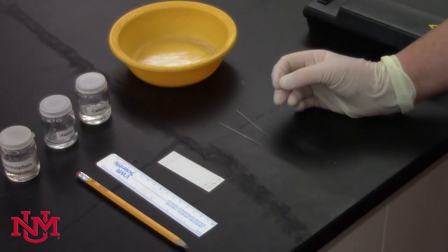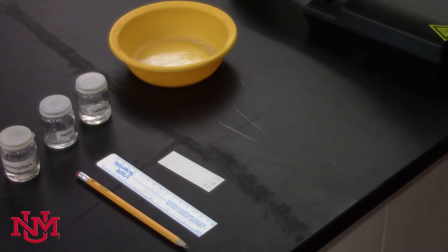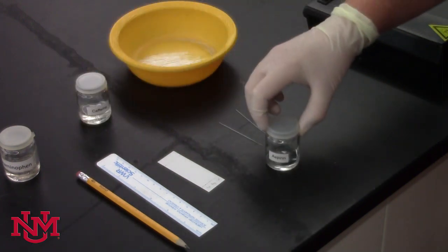Once you've done that about five or six times with a tiny capillary like this, discard the capillary because you don't want to contaminate anything else, and take the second standard.